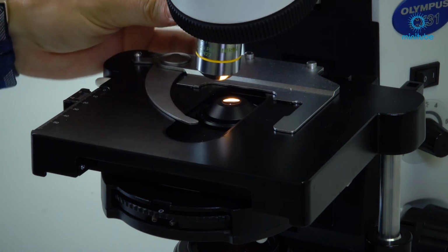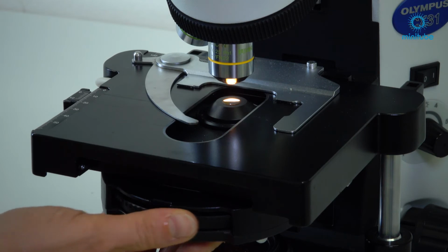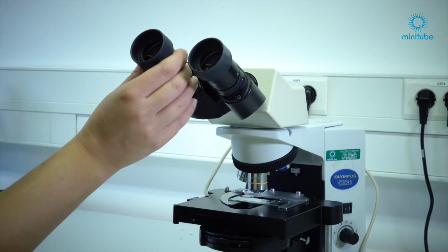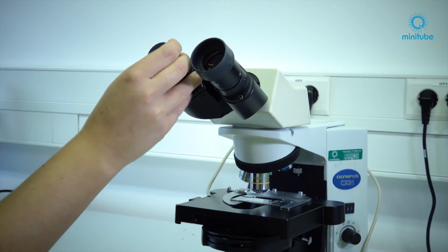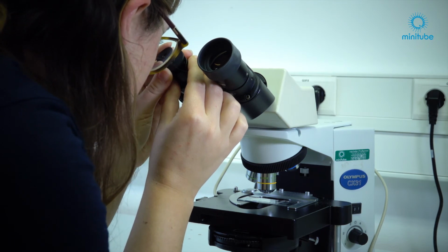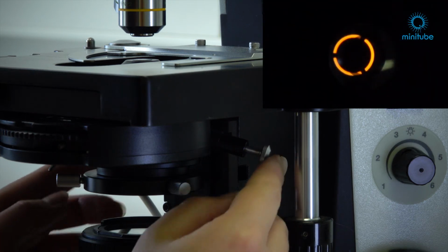To adjust the phase contrast, swivel the objective into the beam path and turn the condenser's revolver disc to the same label. Remove an eyepiece from the tube and replace it with an auxiliary microscope. Use the adjusting fixture on the auxiliary microscope to focus the annular diaphragm and the phase ring. Use the two screws on the back of the condenser.